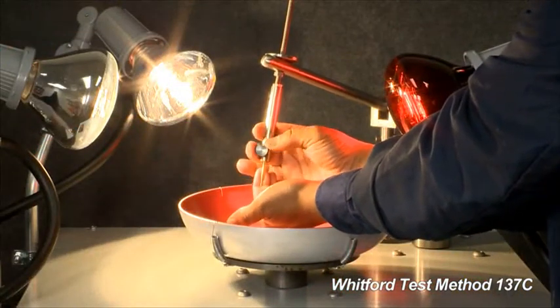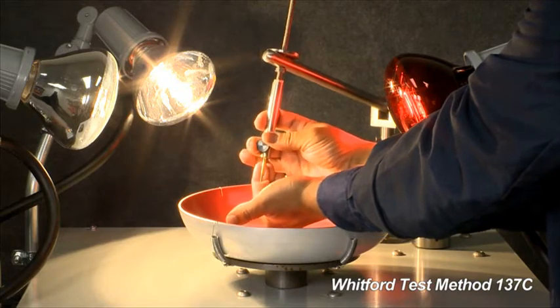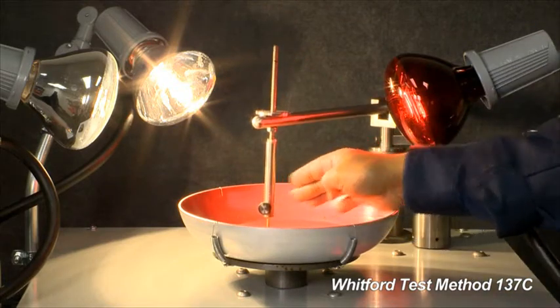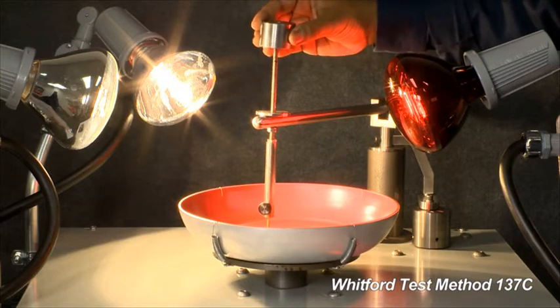A ballpoint pen tip is used to abrade the coating. The test is accelerated by adding a weight of one-half kilo.